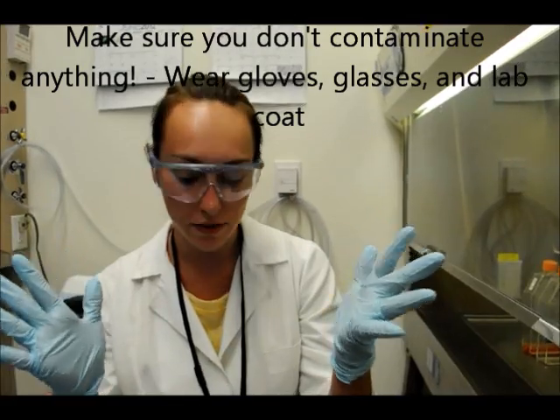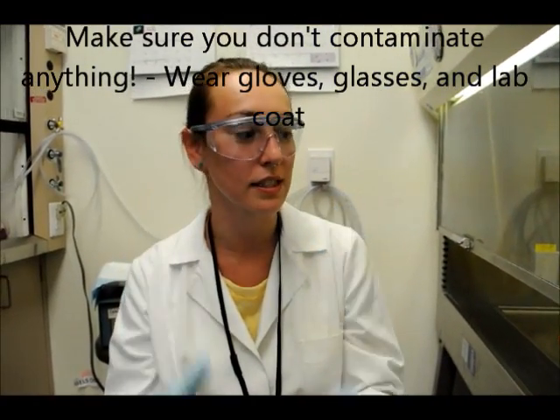We have to wear gloves, lab coat, glasses. You want to prepare everything first. You want to sterilize your workspace, work in a hood, get everything prepared.